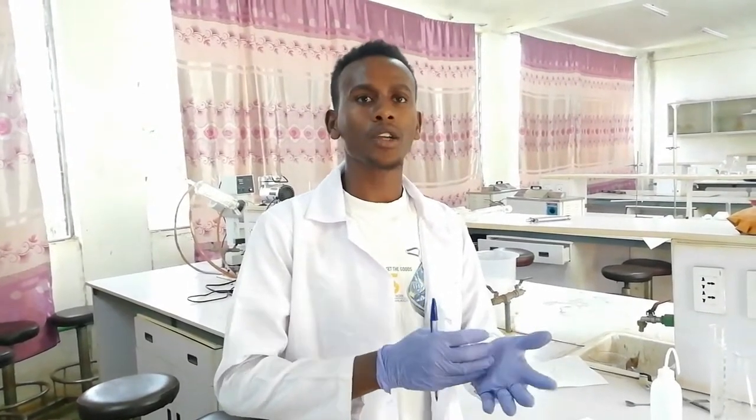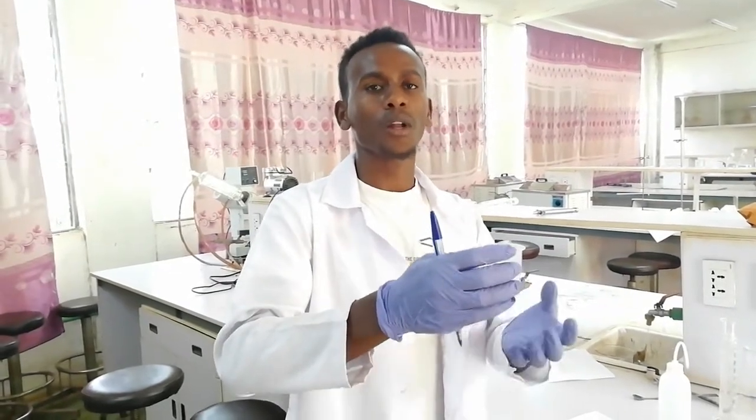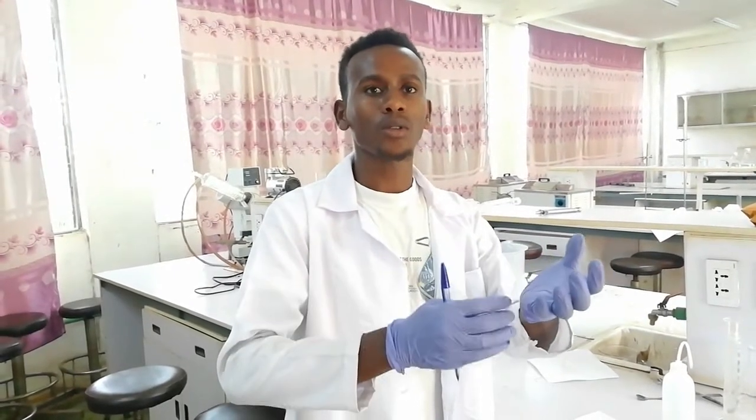Dilution means preparation of a less concentrated solution from a more concentrated solution. We are going to dilute the 2-molarity sodium hydroxide solution to a less concentrated solution, which is 1-molarity sodium hydroxide solution.